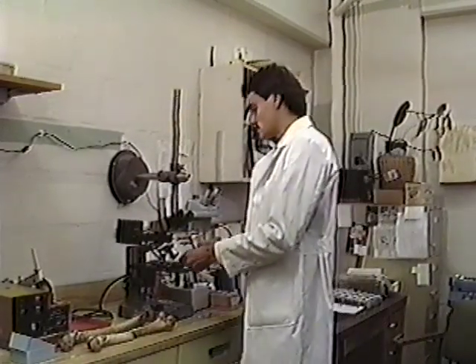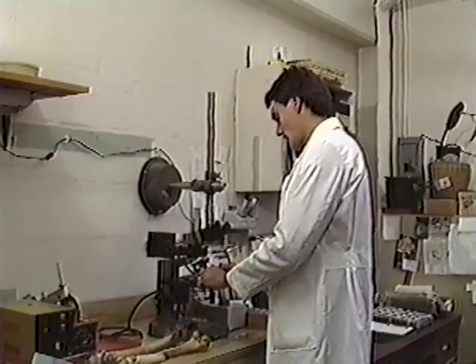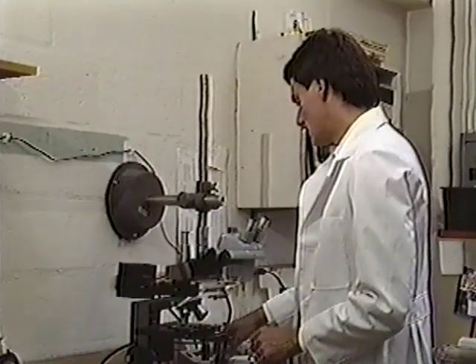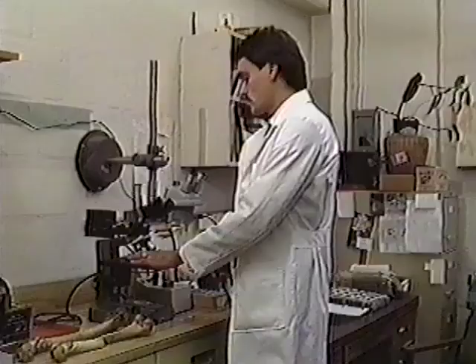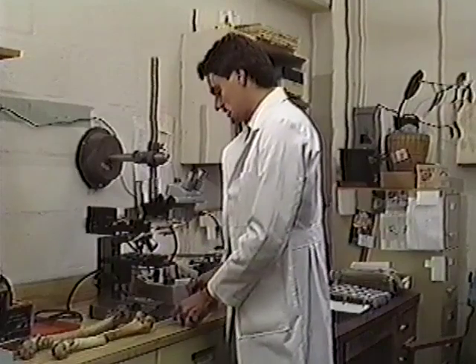As we put a specimen under the microscope, we can see the differences with advancing age. Here's an individual who was in his early 20s, and in this particular field you can see there are very few remodeling structures, the round structures with the concentric circles within these structures, very few remodeling structures in this field, but the formative structures, the original structures in the original formation of bone, are still present, the circumferential lamellar bone and the non-haversian canals.